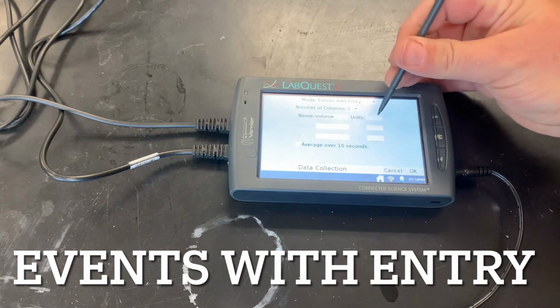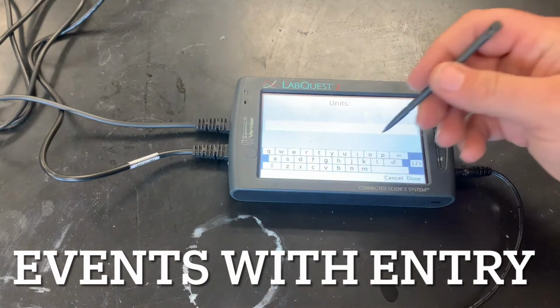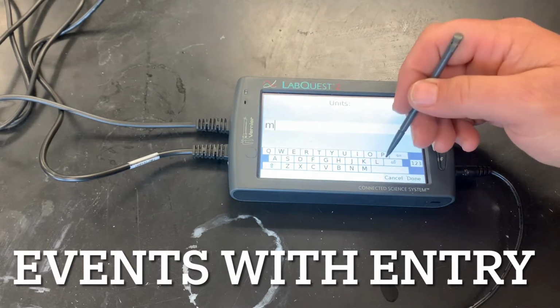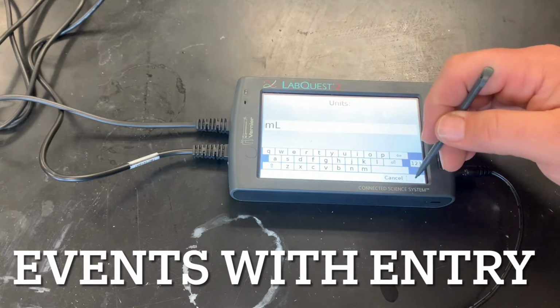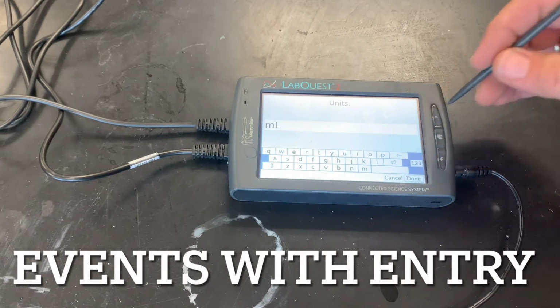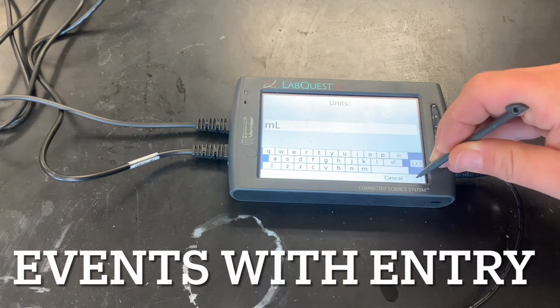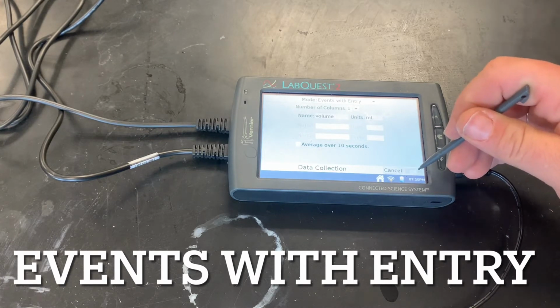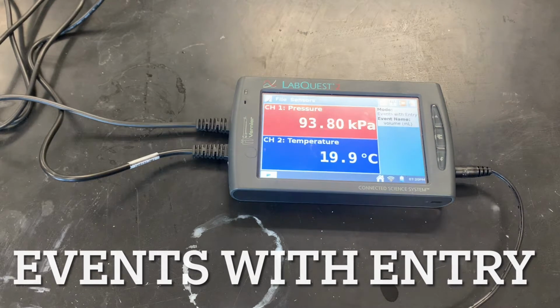And you can go ahead and put the units in there as well. Those would be milliliters. And just say done. And say okay. Okay, once we have that, we are going to make sure we're all set up.